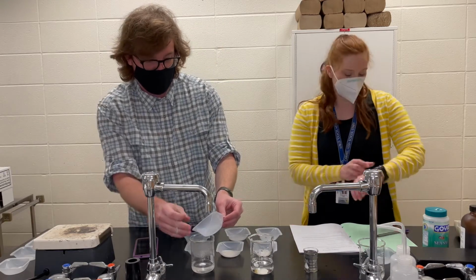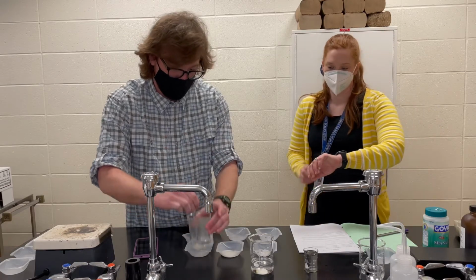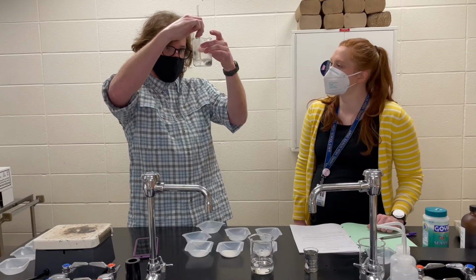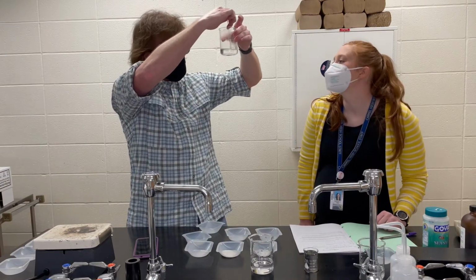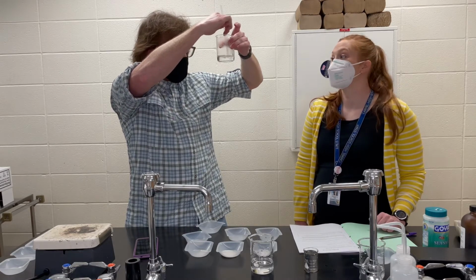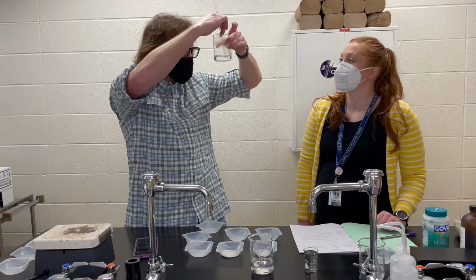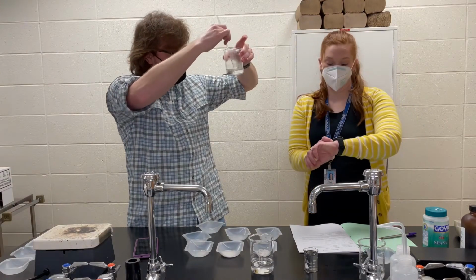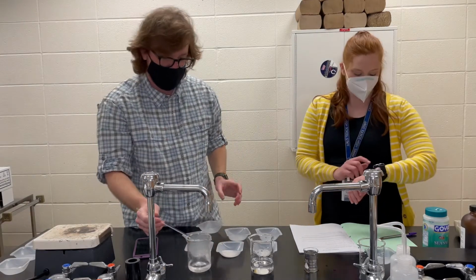All right, I'm ready. We're gonna go ahead and dump in our hot, and I'm gonna start stirring. You got our timer ready? I'm going. And while we're stirring, I am looking at the bottom and sides to see when all of the salt has disappeared. It's getting close to gone. You got a better angle than I do. I am not seeing any more. I think that's it. Let's call it. 24 seconds! Only 24 seconds for that hot beaker.